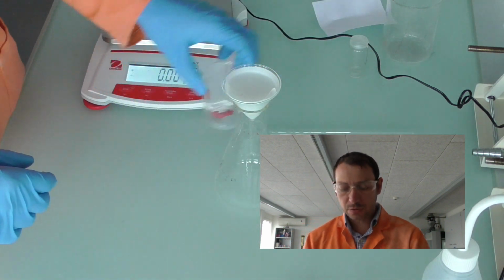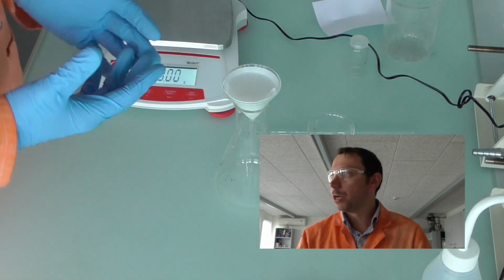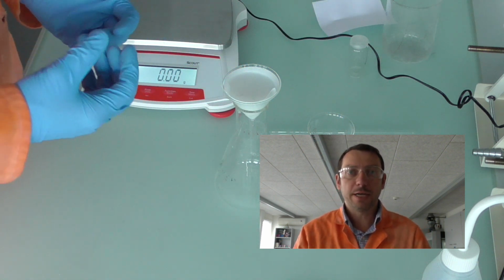And that's the practical. Overnight we're going to leave it and let it dry in the oven, and we're going to measure the mass of the silver chloride produced. In that time we're going to try and calculate which is the limiting reactant. Is it the 1 gram of silver nitrate or the 1 gram of sodium chloride? Then we're going to predict how much we should have, and by measuring our mass at the end we'll be able to calculate how much we did get, and through that we can see our percentage yield.